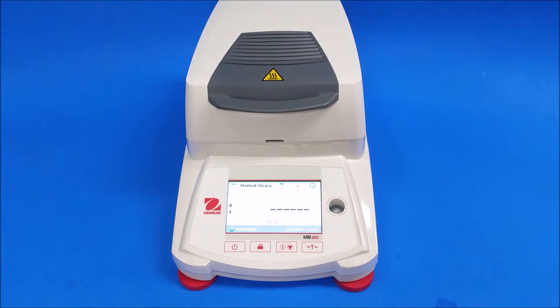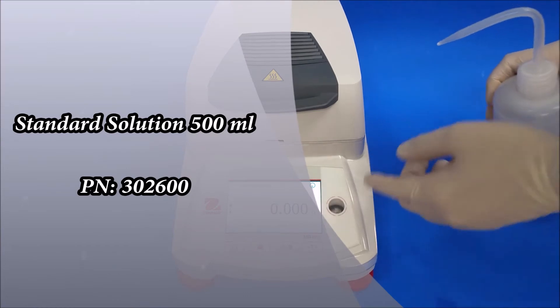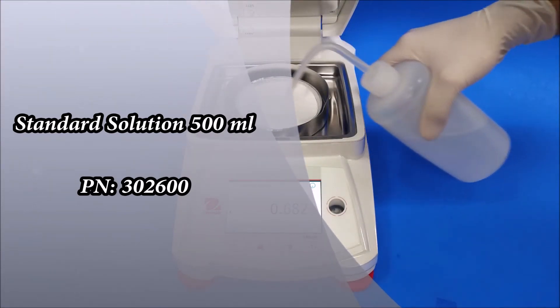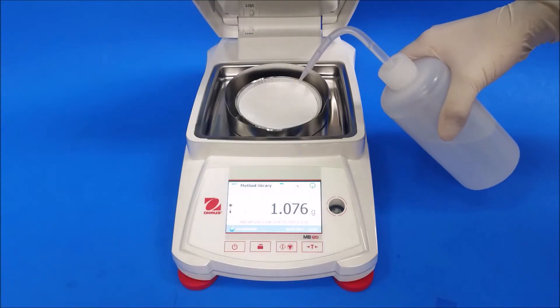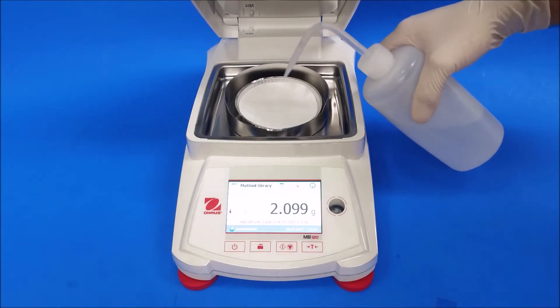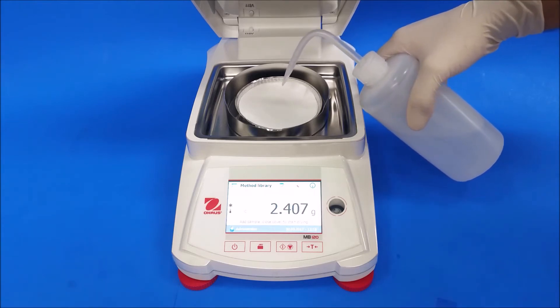it tares itself. Now it's asking to add the sample. I add about 2.5 grams of our standard solution.